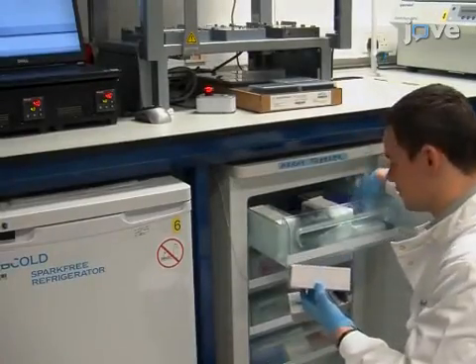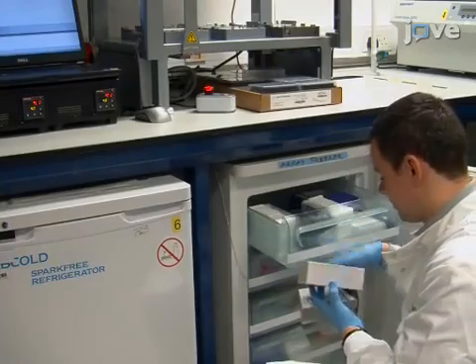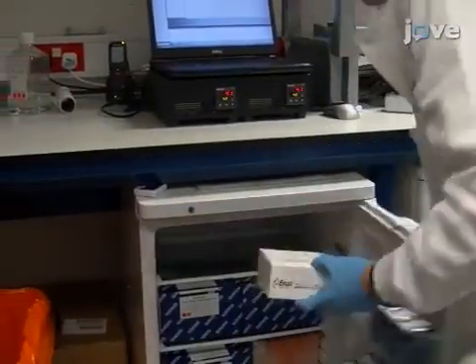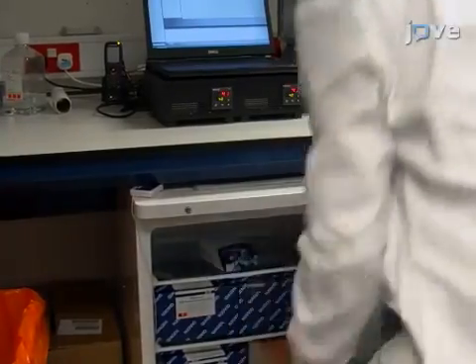Before beginning the labeling reaction, thaw the ready-to-use 96-well plate of nucleotides and primers at 4 degrees Celsius and protected from light for about an hour.